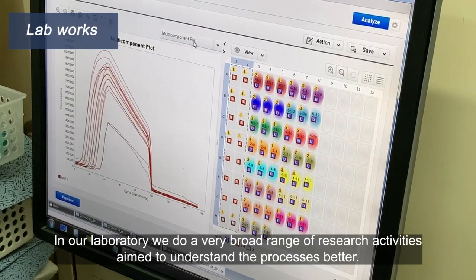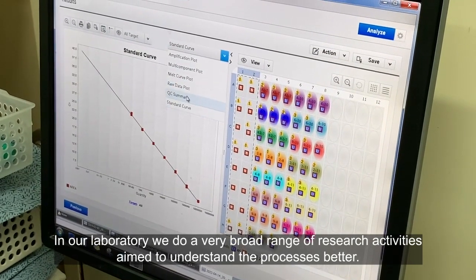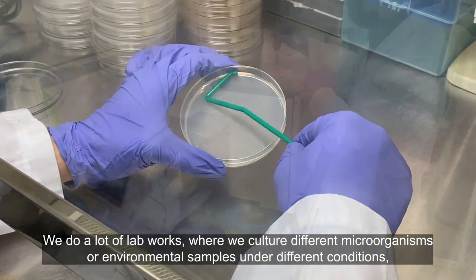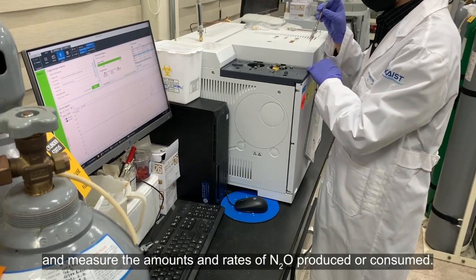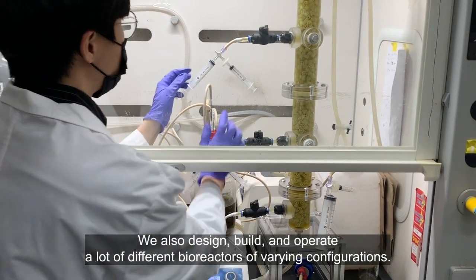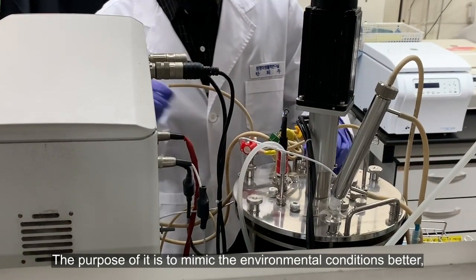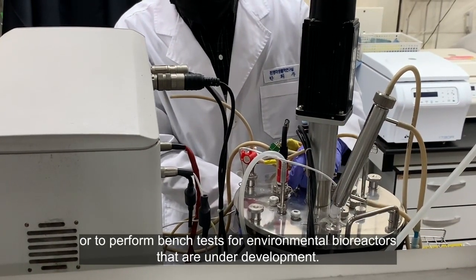In our laboratory, we do a very broad range of research activities aimed to understand these processes better. We do a lot of lab work where we culture microorganisms and environmental samples under different conditions and measure the amounts and rates of nitrous oxide produced or consumed. We also design, build, and operate many different bioreactors of varying configurations, to mimic environmental conditions better, or to perform bench tests for environmental bioreactors under development.